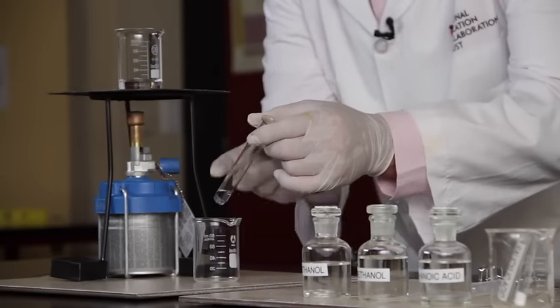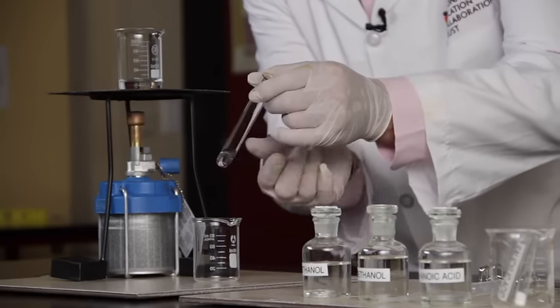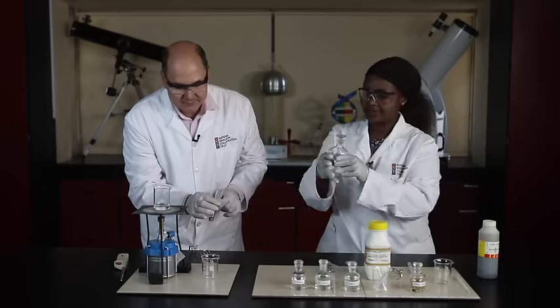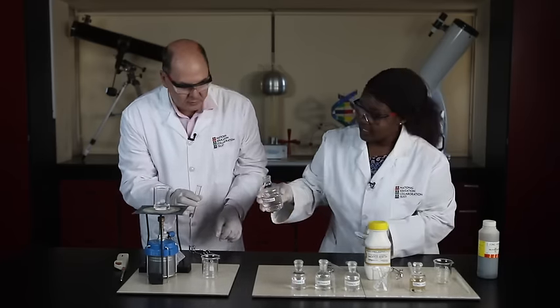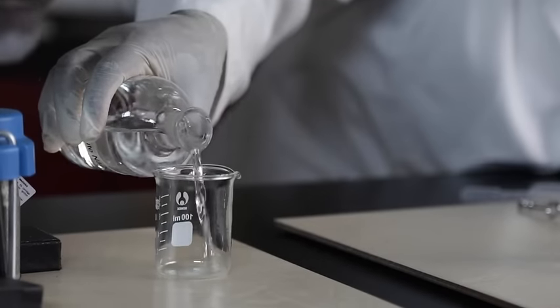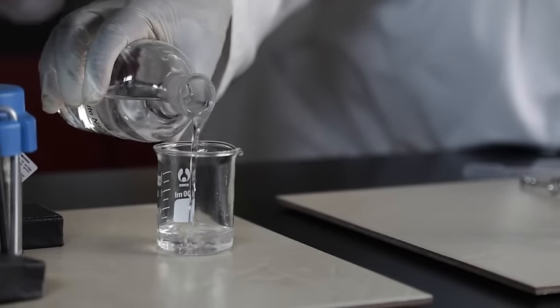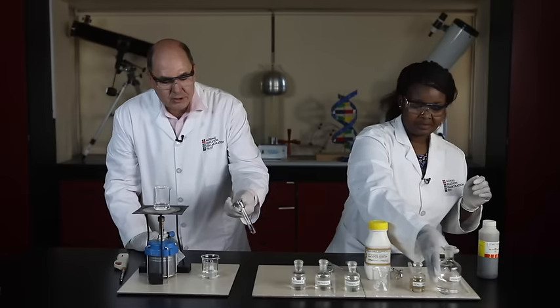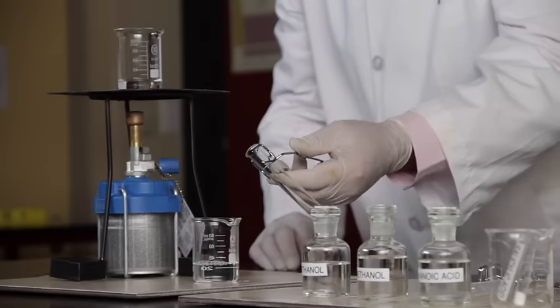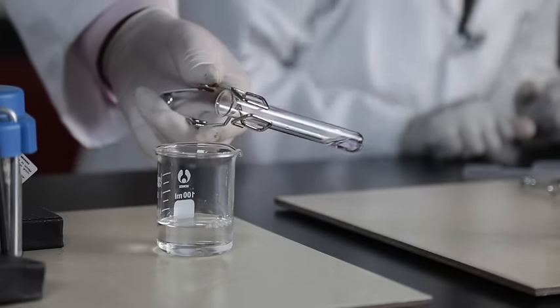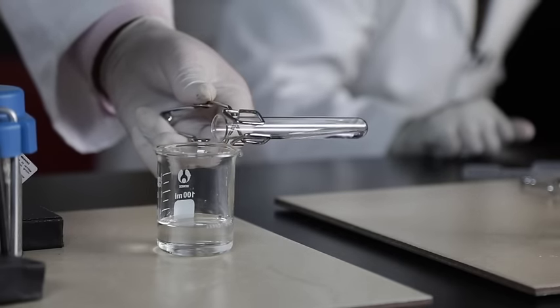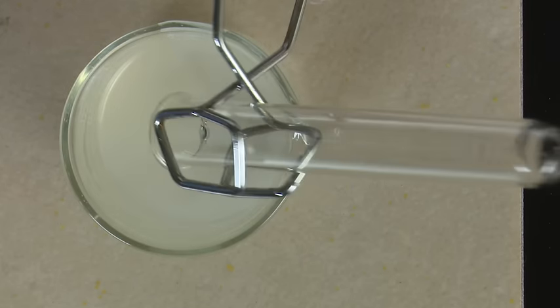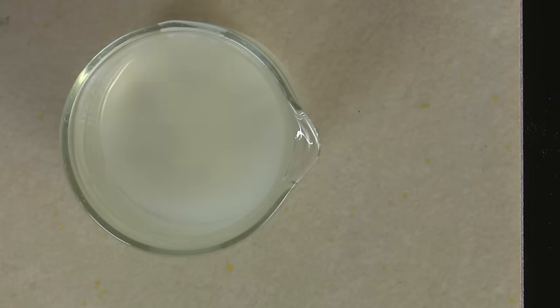Right, let's check. This reaction mixture has cooled down nicely. So let's get ready. Let's add dilute sodium carbonate in here. And now I'm going to pour in the reaction mixture. Oh, isn't that great. Right, let's stir a bit.